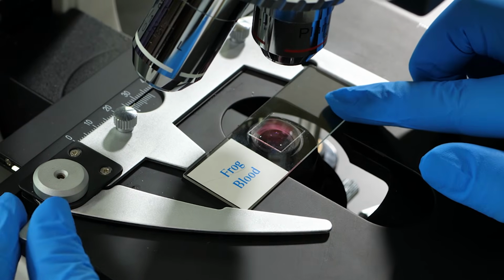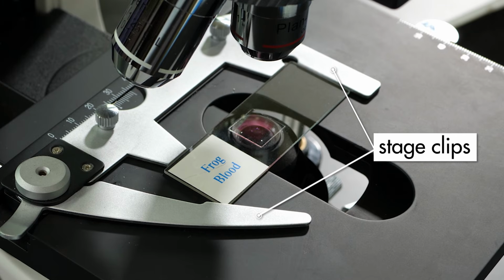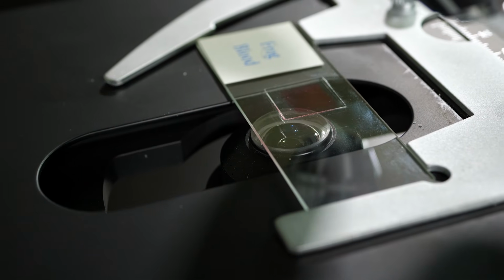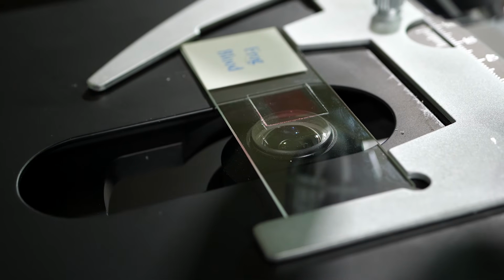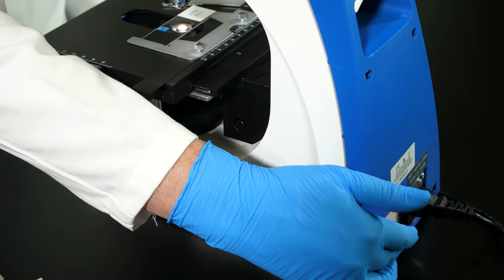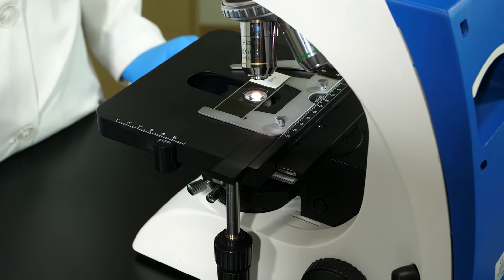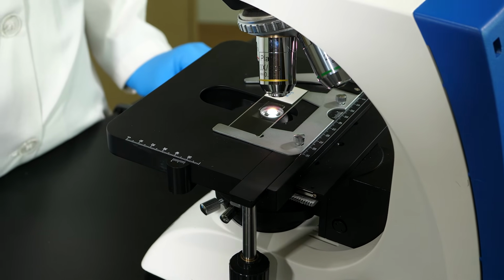This microscope has a mechanical stage, so the clips will automatically snap to the slide to hold it in place. If the microscope had a simple stage, we would slide the stage clips onto the slide to hold it in place. Next, we center the specimen over the aperture. Now we are ready to switch on the light source. If we had a simple microscope, we would adjust the mirror so the light is focused through the aperture.